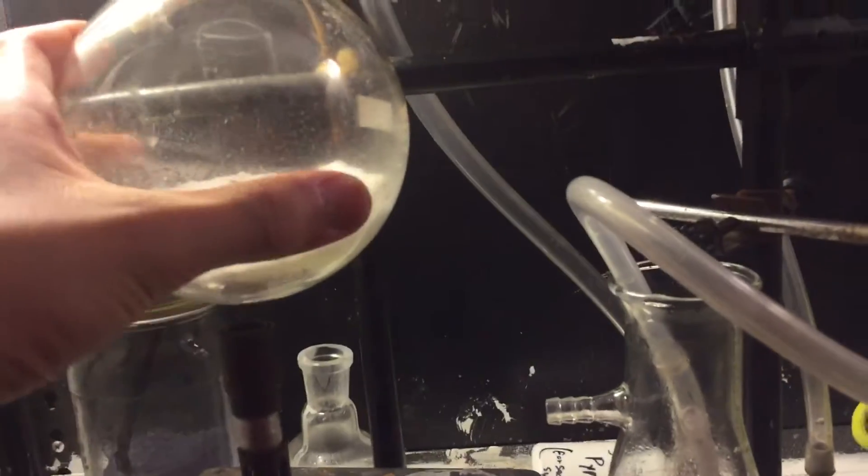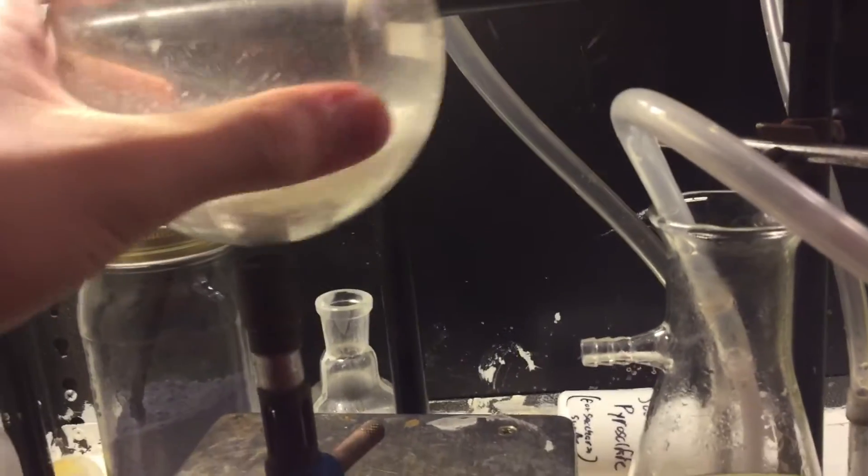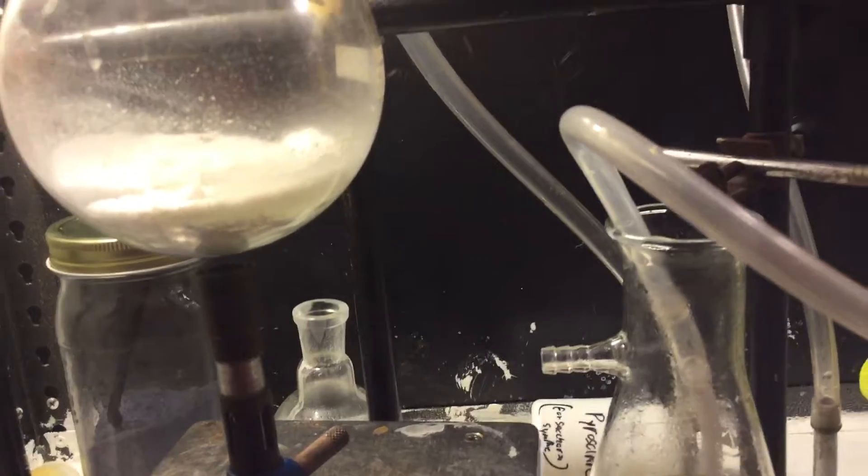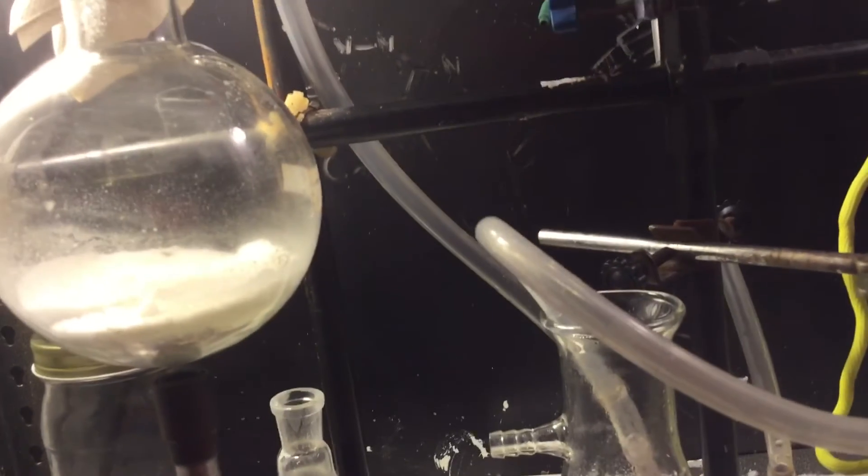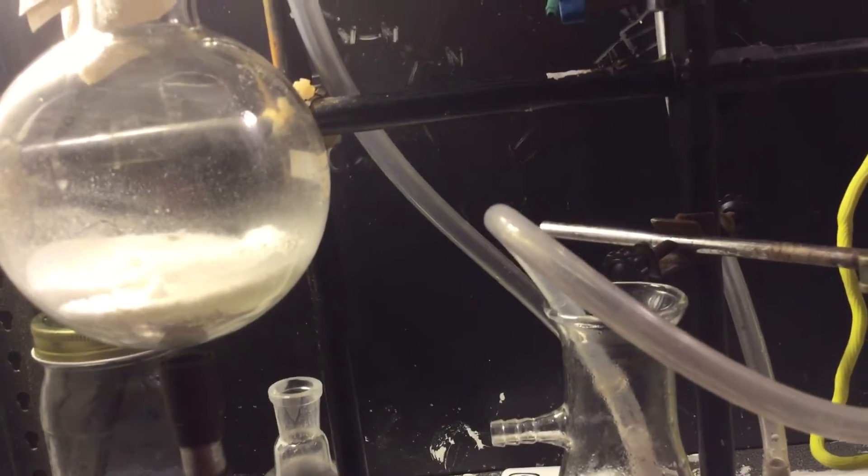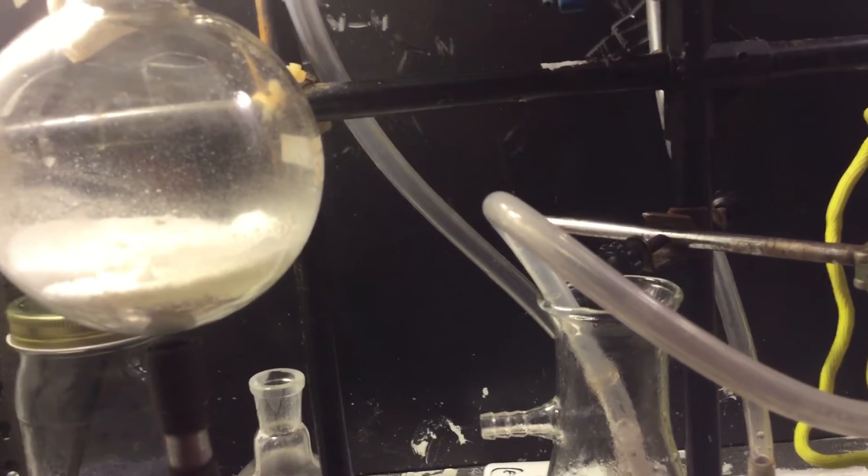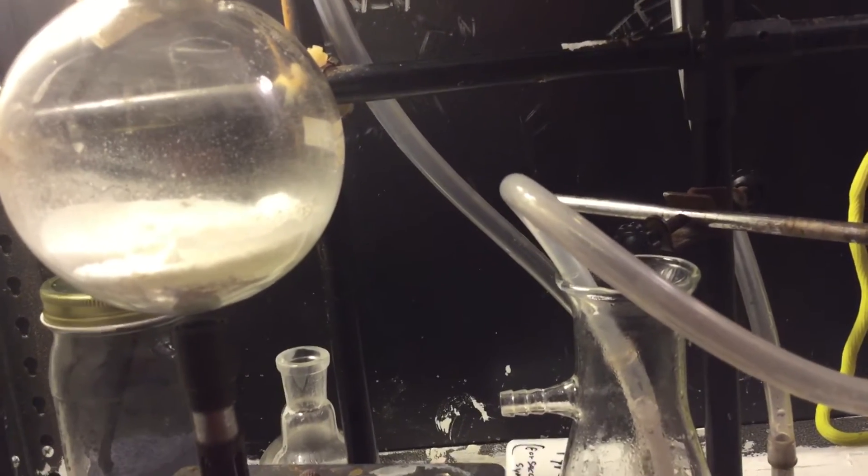I guess I sort of want you guys' help, because this was well over 400 celsius, so I don't know why nothing evolved. There was some fuming, but that's just probably some water.